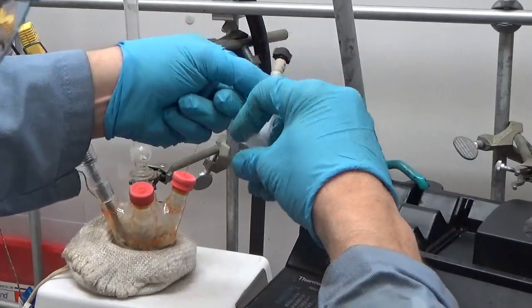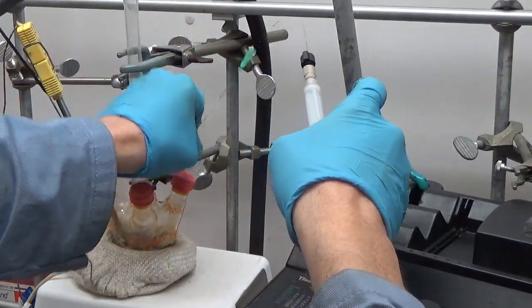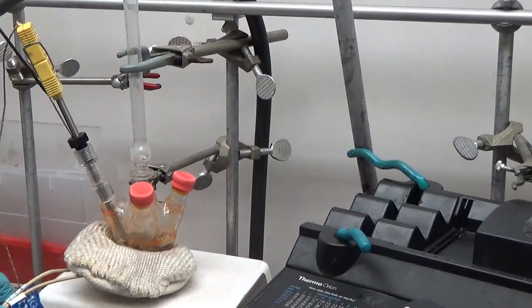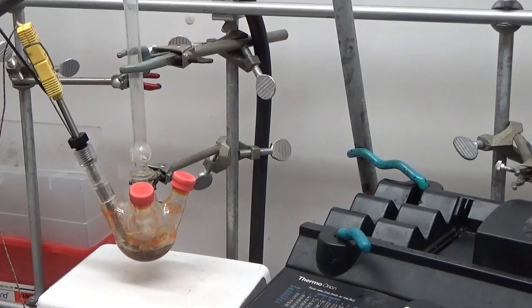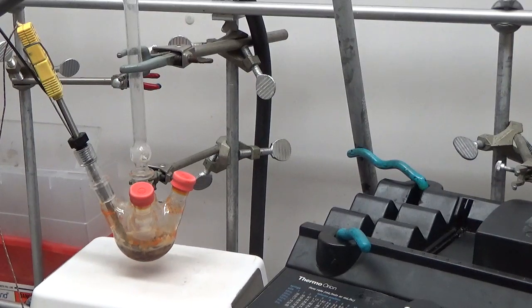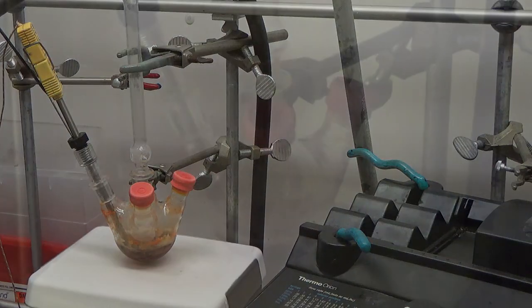Those capillaries have to be immediately cleaned. If not, they'll get TOPO in them - they're pretty expensive. So those have to be cleaned within about a minute of taking them out of the vessel, otherwise they'll get clogged with TOPO. I know the QDs don't look good - the camera is kind of accentuating that, especially when they're still hot. It kind of looks like a lot of organic decomposition.